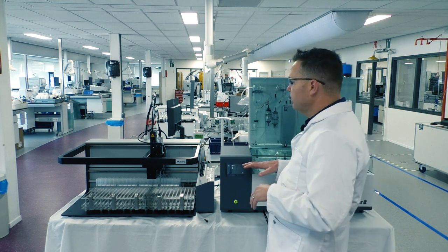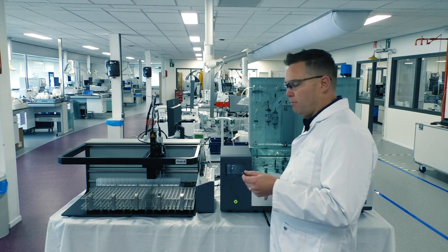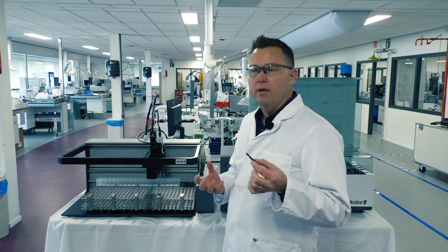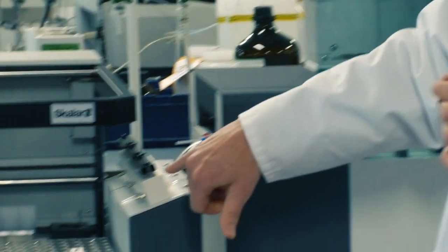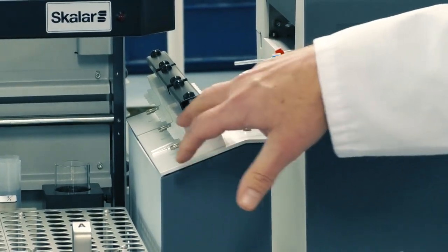One of the key things that we talk about too is our valves. So if we look at our valves, we have a plunger system, and it's not an electronic Lee style valve, which is very critical because those are prone to clogging. So the apertures on the inside of this rinse valve you see here are fairly large. So to plug these are very difficult.